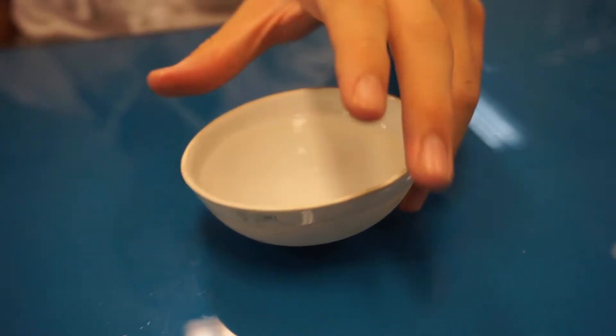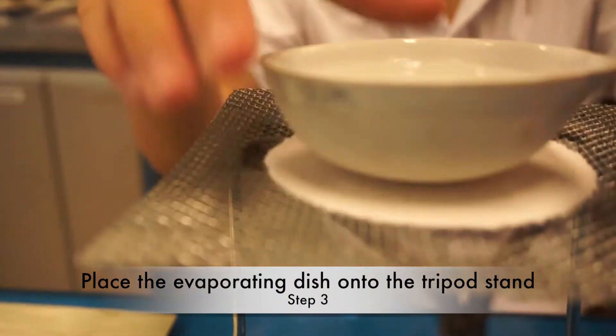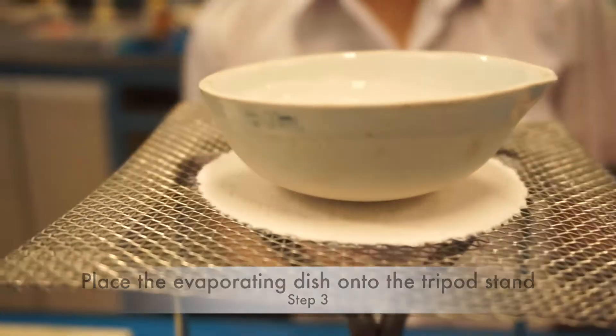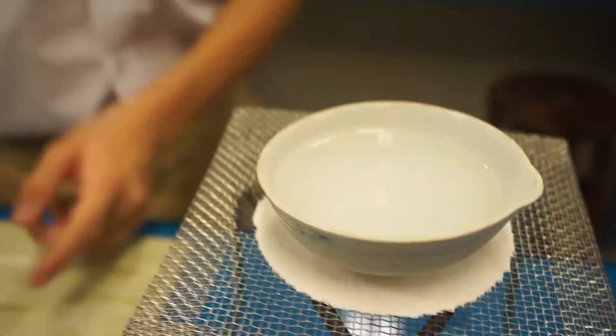After pouring the solution into the evaporating dish, place the evaporating dish onto the tripod stand with the wire gauze steadily. Here is the view of the evaporating dish from the top.